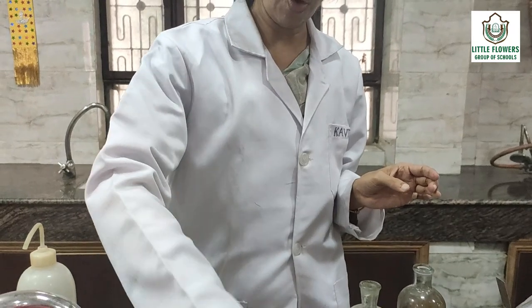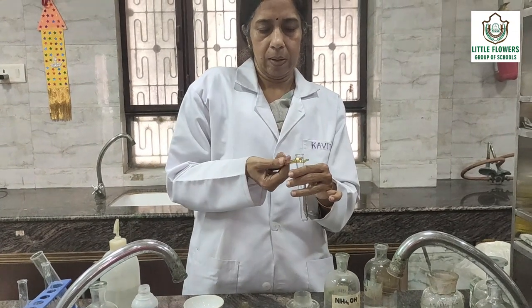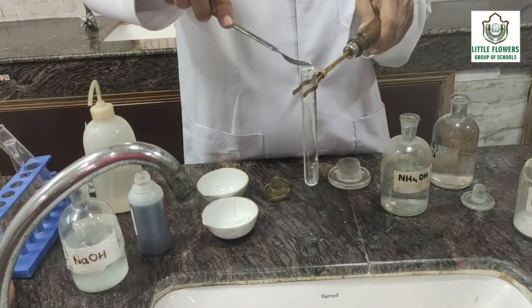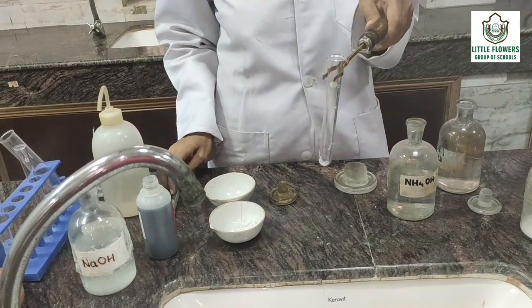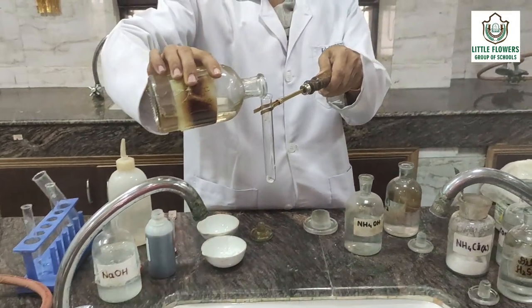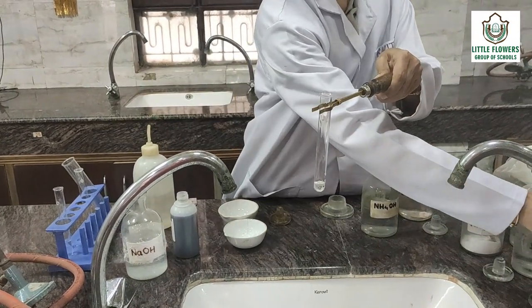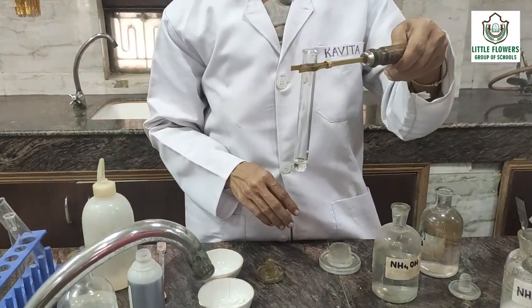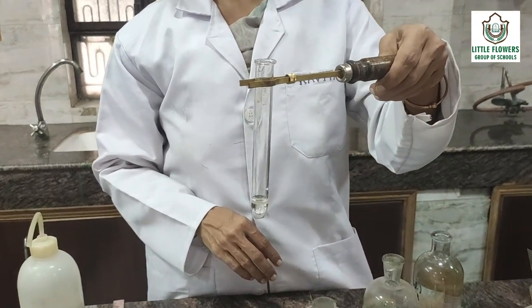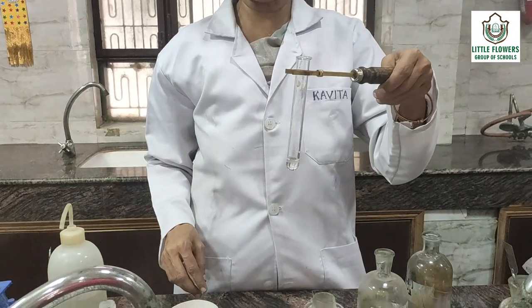Now we will proceed for the concentrated sulphuric acid group. As you know, concentrated sulphuric acid is harmful, so we will do it very carefully. Take the salt, add concentrated sulphuric acid. You see — no colourless gas with pungent smell, so chloride is absent. No brown fumes, so bromide is absent. No vinegar-like smell, so acetate is absent.